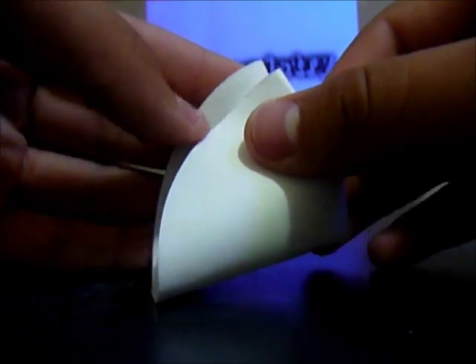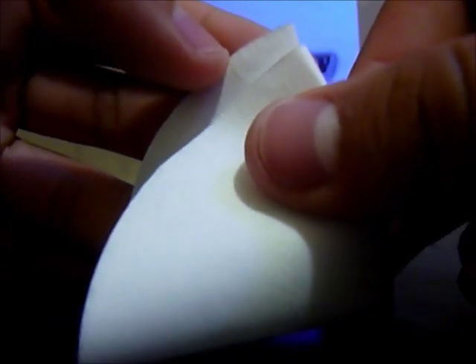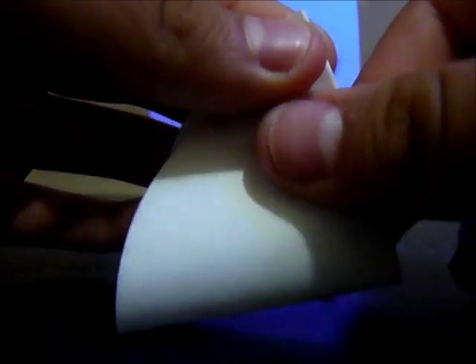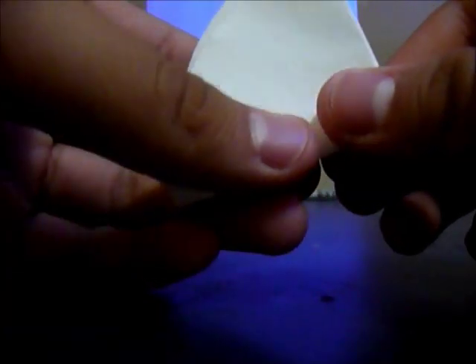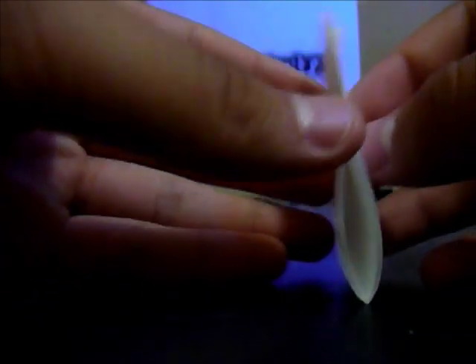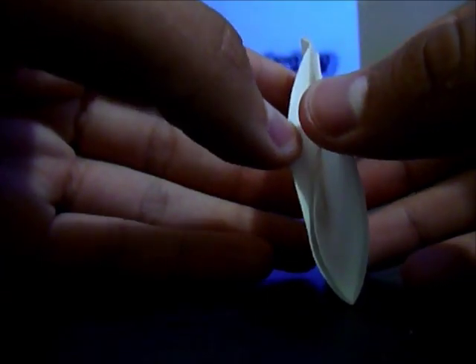And as you see, I'm leaving a little part right here open. Okay, so just fold it, but not too hard. And now just open it on this thing.